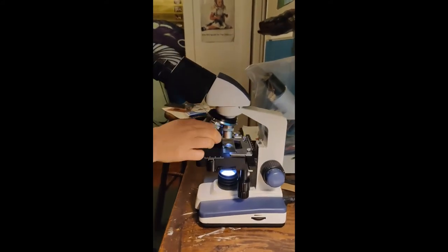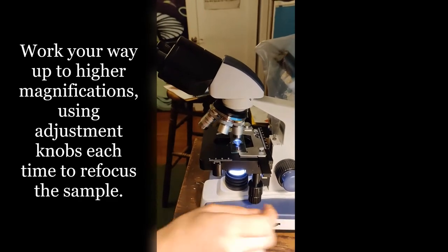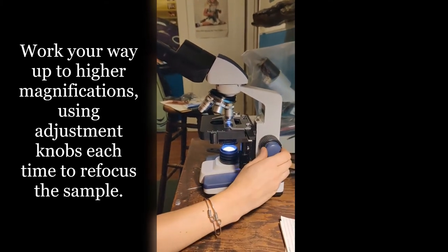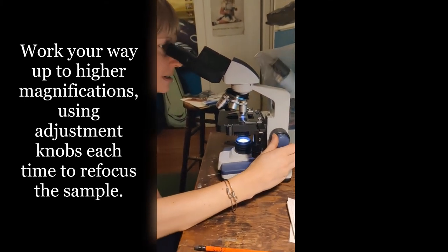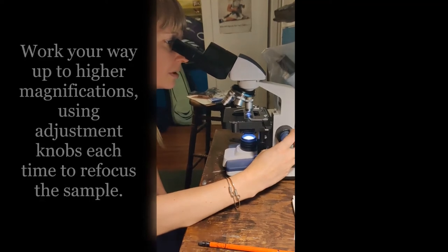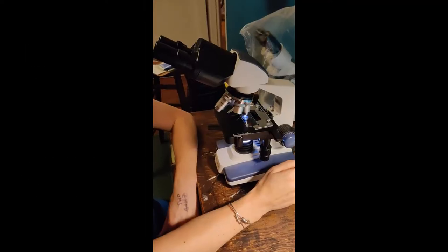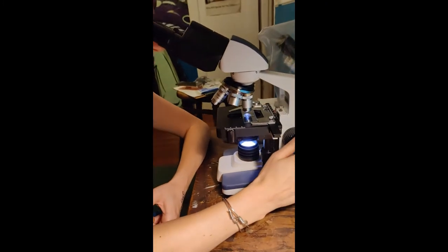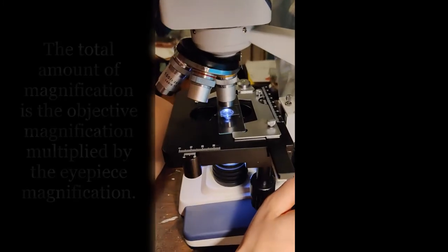And then I'm going to go to a higher magnification, so it's zooming in more. And then I'm using my fine focus again to zoom in more. So now I have my spores on the screen. I've got tons and tons of spores. This is great.